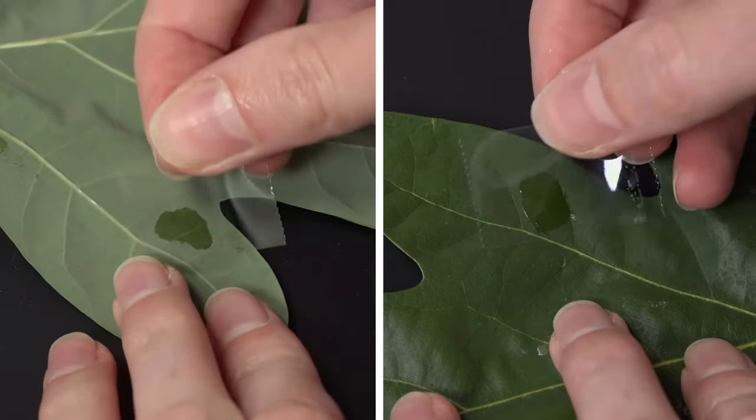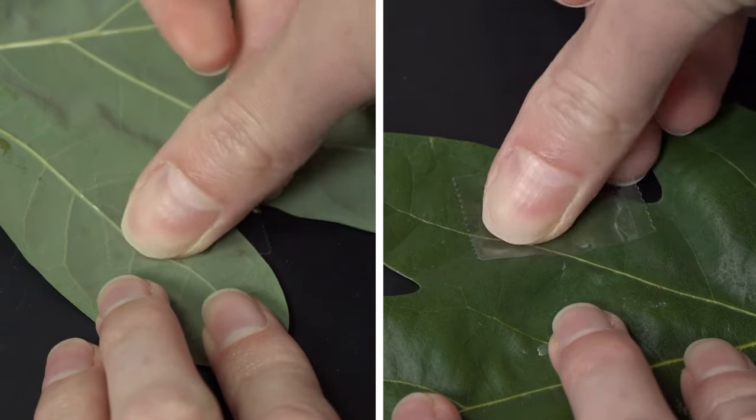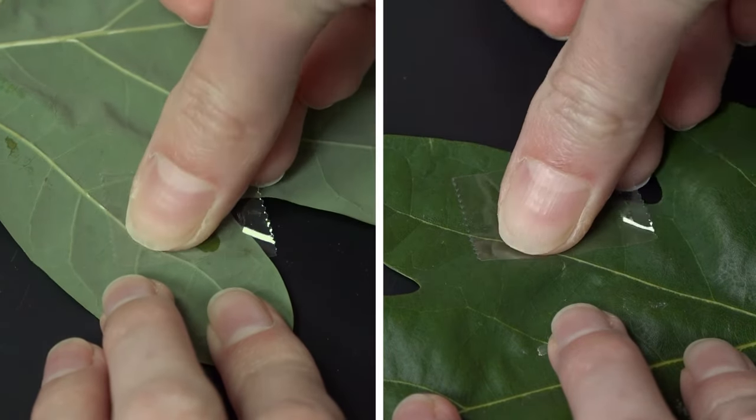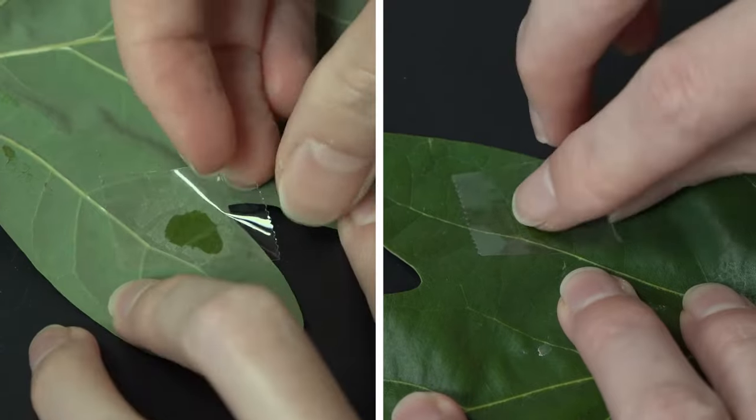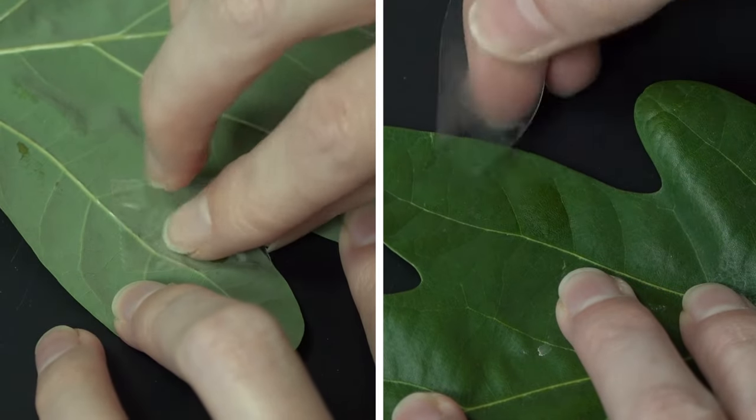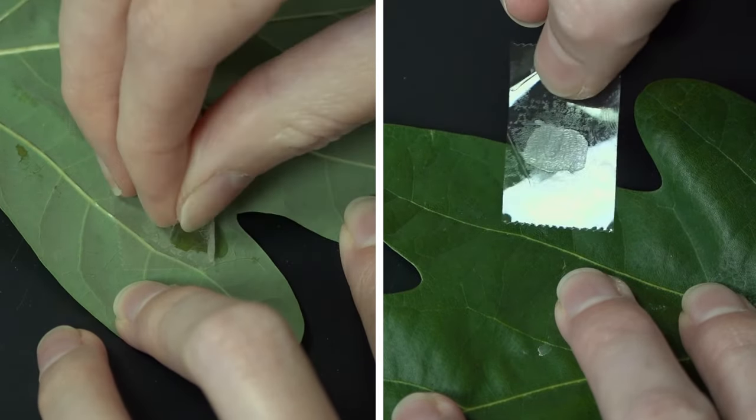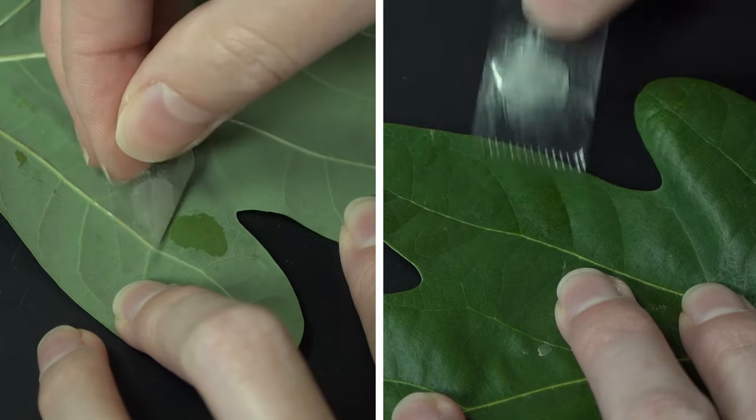Once the nail polish is dry, I'm going to cover the patch in tape, press down, and then peel back. The nail polish patch comes right up with the tape.